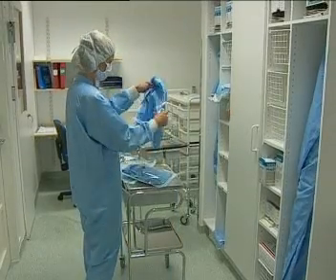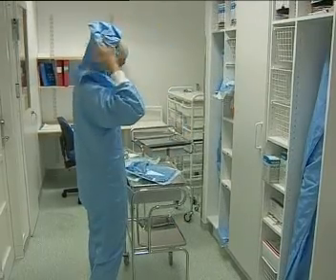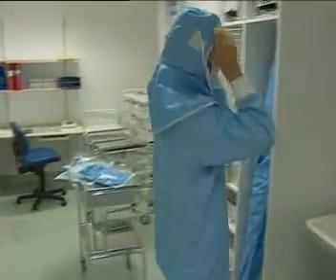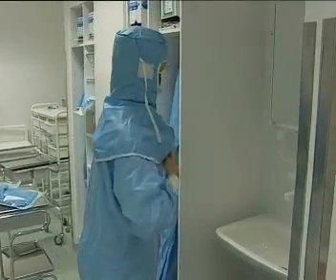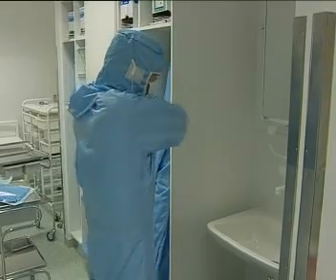After this, a sterile hood is placed over the head and neck. This is tucked under the neck of the bodysuit to ensure that loose ends are secured.